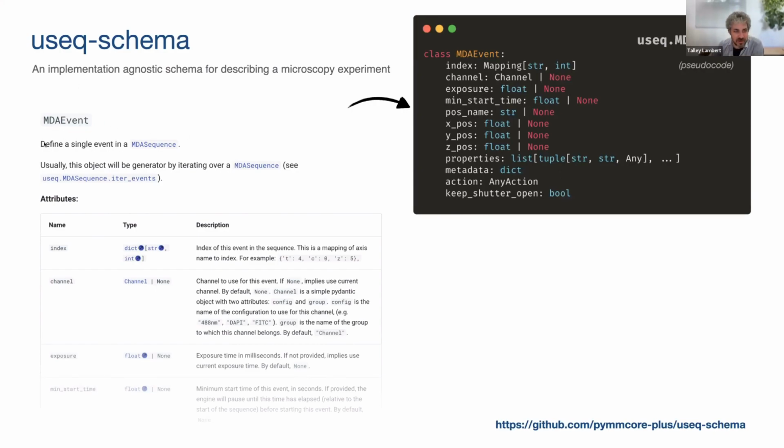So the MDA event defines a single event in a sequence. It's got a channel, maybe an exposure, a position, an index in the broader scheme of the experiment. So this might be T0, C1, Z3, whatever. And then there are a few places for customization. So metadata is just any key value pair. So if you were, say, trying to do something combining Micromanager and custom Python acquisition or device driving microfluidics or some Raman scope or whatever, you can put whatever you want in metadata, and then you can customize your engine a bit to look for your custom metadata and do whatever action you need to.